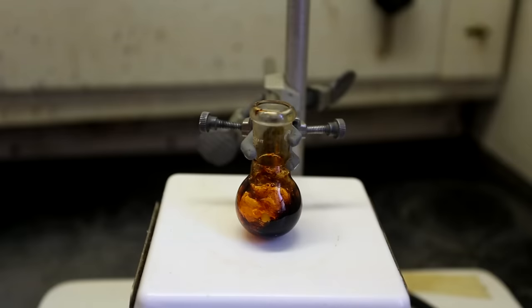If you completed the extraction using food grade solvents and materials then you can test it if you're brave enough. Take a toothpick and scoop up a small microscopic drop with the tip of it. If you touch it on your tongue I can guarantee you that the potency is enough to make most people extremely uncomfortable.